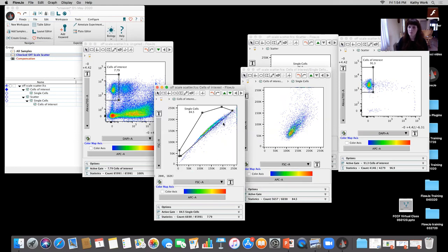So I know the researcher before was asking about importance of debris exclusion and everything like that. We have to be very mindful based on the experiments and what our end goal is and what we're looking to get out of it. So now someone might look at this and say, okay, what's the big deal?